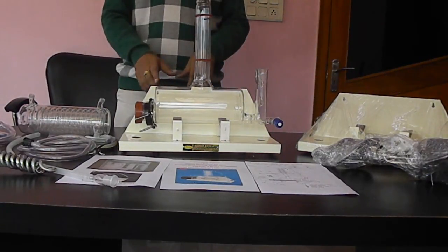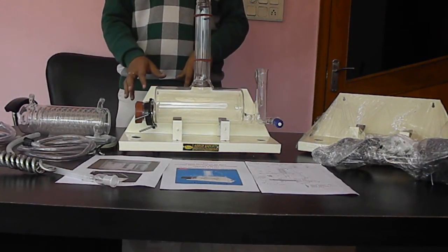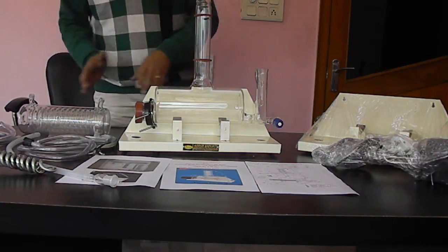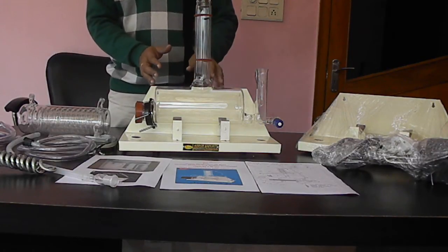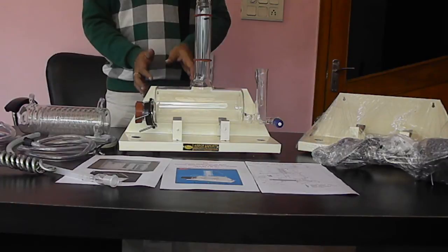Today we will learn the automatic distillation modern design with a vertical condenser. How to assemble the parts and how to use it.